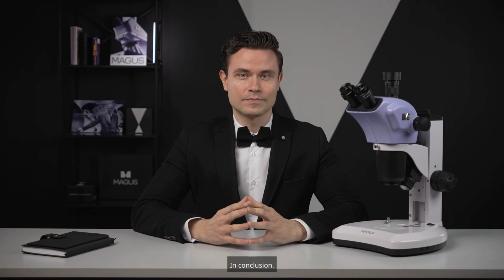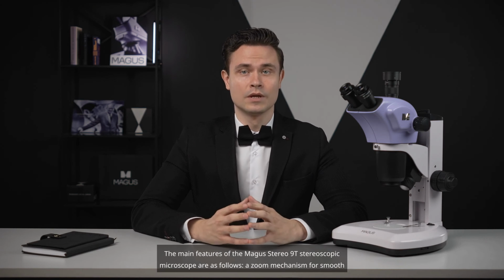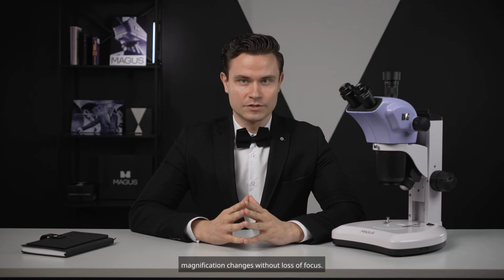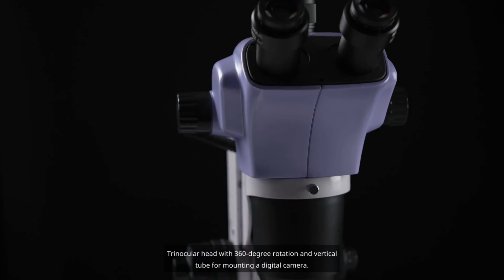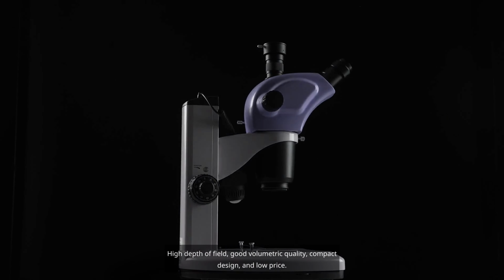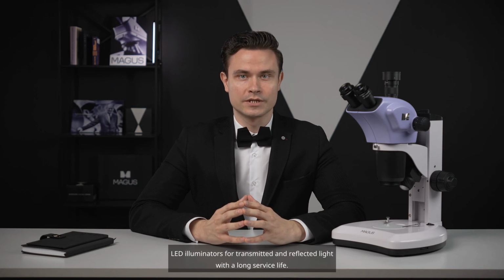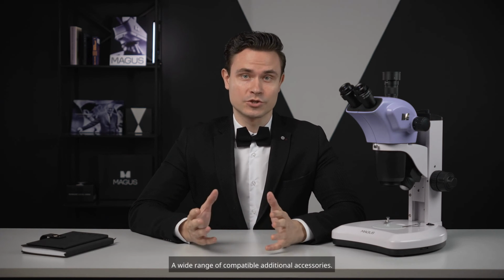In conclusion, the main features of the MAGUS Stereo 9T stereoscopic microscope are as follows. A zoom mechanism for smooth magnification changes without loss of focus. Magnification ratio of 9:1. Trinocular head with 360-degree rotation and vertical tube for mounting a digital camera. Advantages of the Greenough optical scheme: high depth of field, good volumetric quality, compact design, and low price. LED illuminators for transmitted and reflected light with a long service life. A wide range of compatible additional accessories.